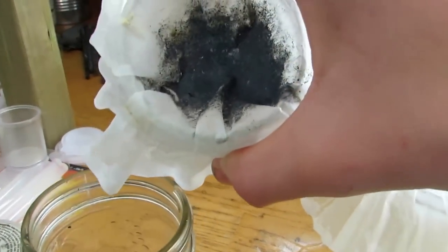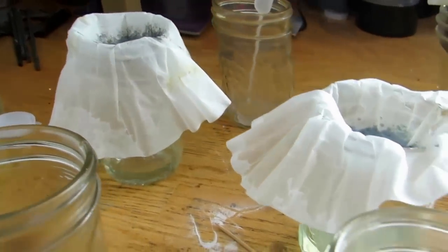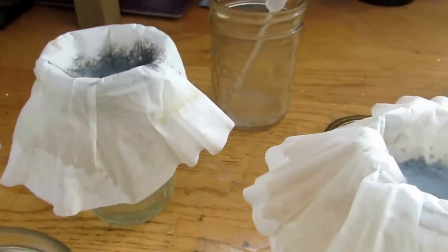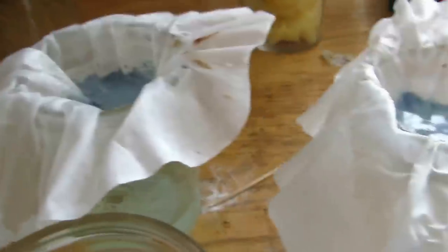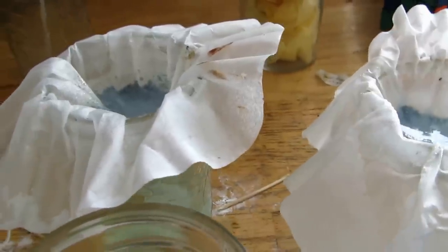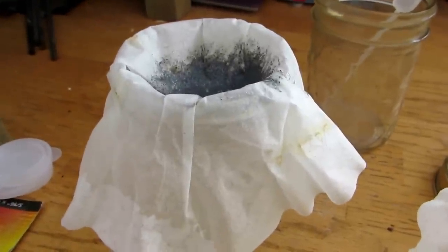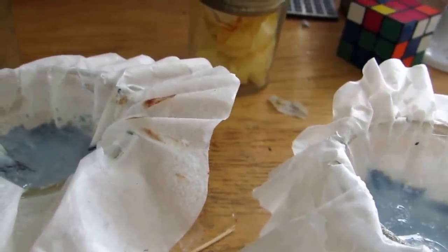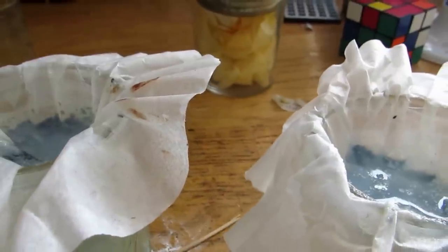Okay, so this palladium solution is done filtering, and this is the pure palladium here. So, this one is all pure powder there, and it looks like it's a lot, but it's actually not a huge amount. Just because it's finely distributed across the filter, and because it's in such a fine form. So, it takes up a lot of surface area. You could melt that into a really teeny bead if you'd like. Now, these other two are not quite done filtering, and they're taking quite a while. But, I devised a process to get the palladium out of these also. I thought that if there is metal impurities in here, which we precipitated out, if we just stick them in some more nitric acid, it should eat away everything except for the palladium. That one won't get palladium that way. But, I'm not going to put that in nitric acid because that's fairly pure palladium, and I don't want to ruin it. So, I'm going to let those filter off, rinse them super well, and then we'll stick them in some nitric acid. I'll be back once I've dissolved off all impurities and filtered it off.